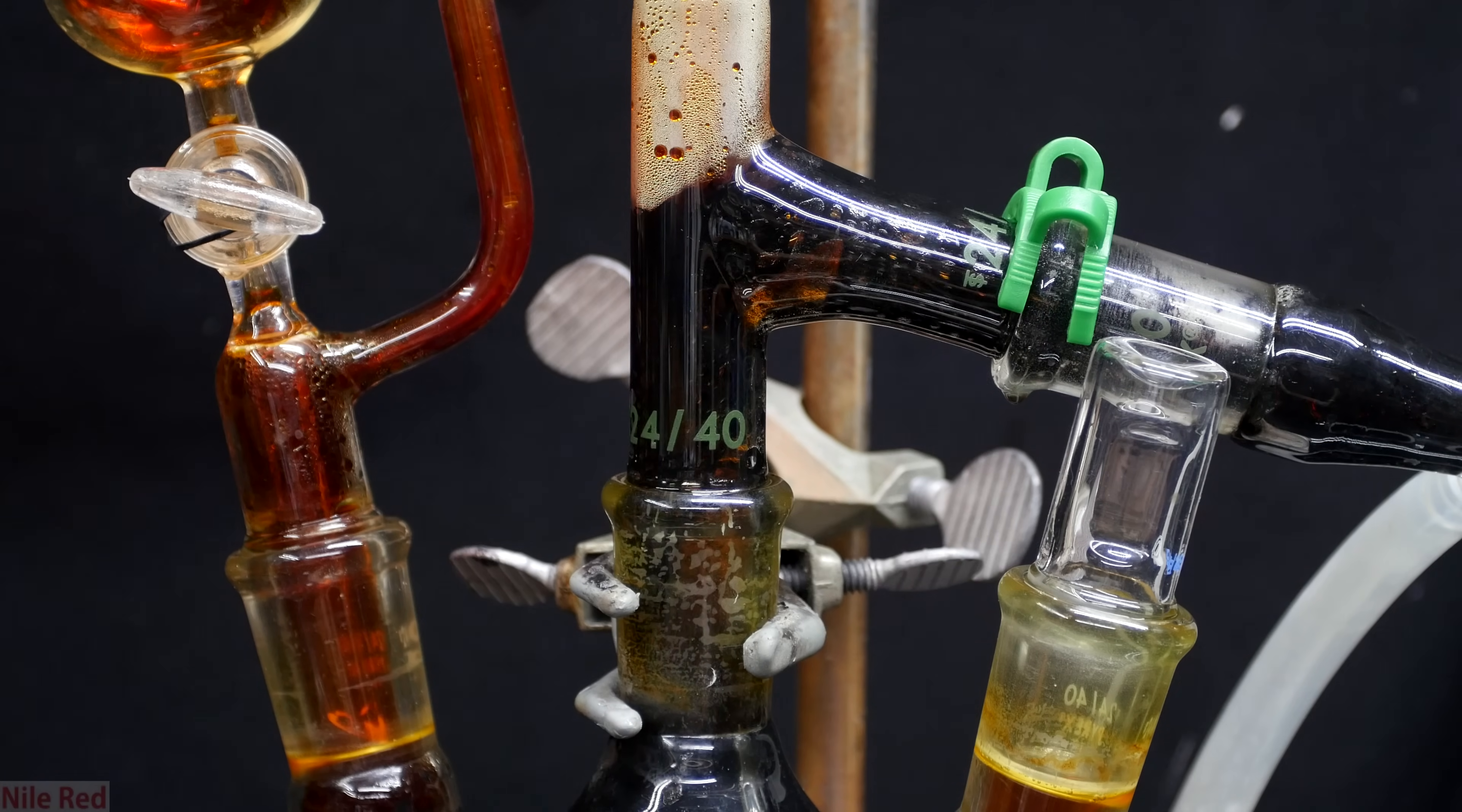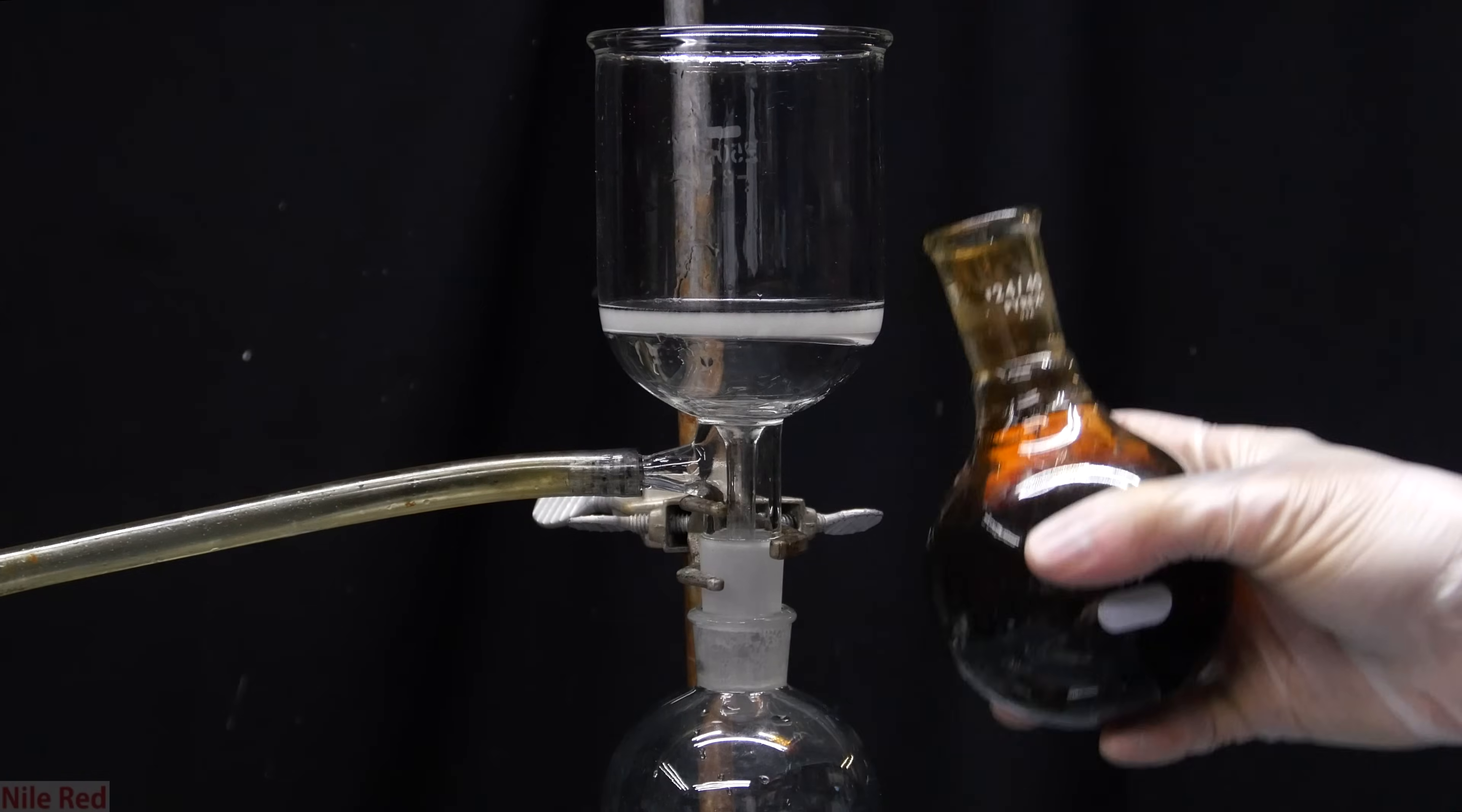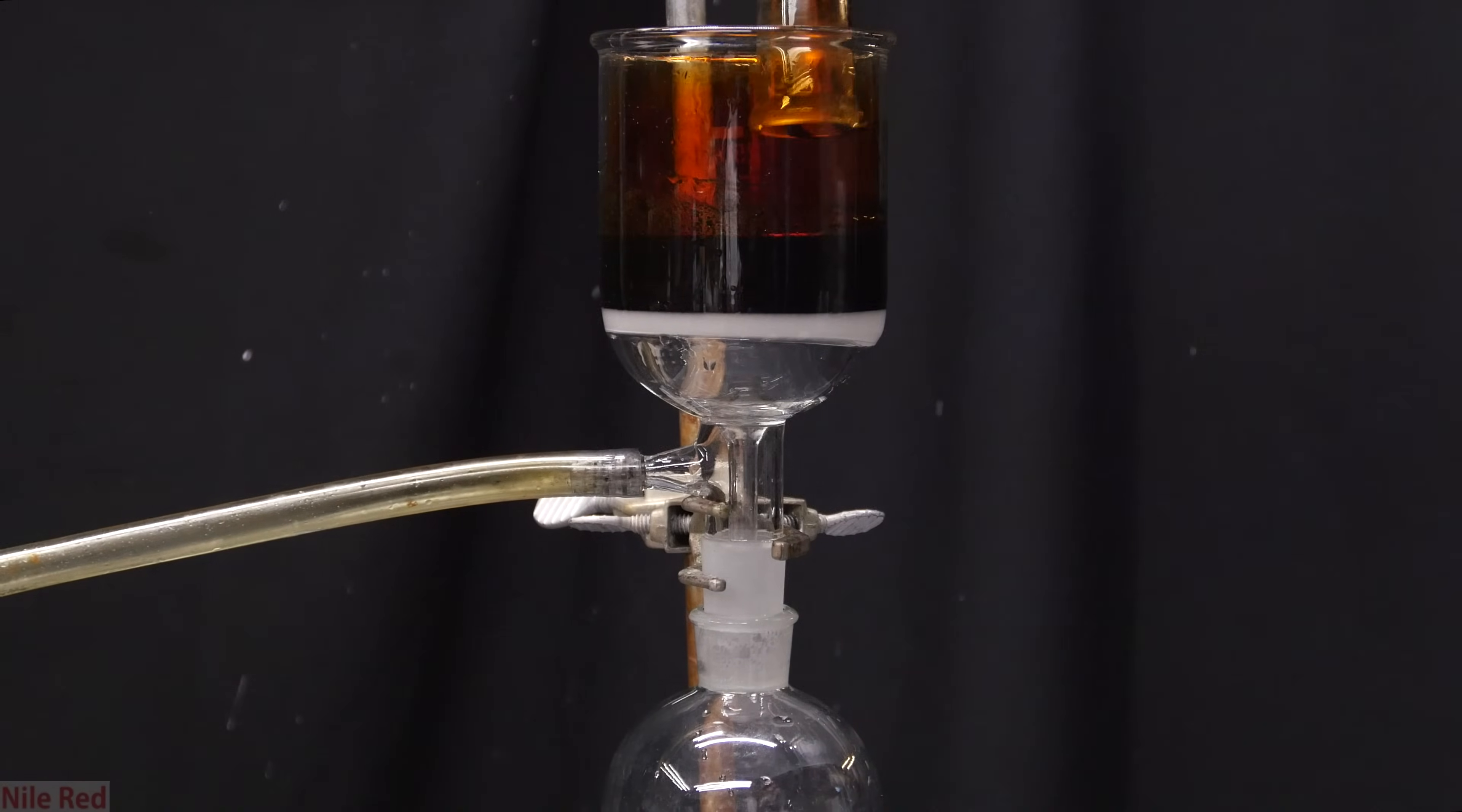I should mention that I did this synthesis just for fun, and it's not nearly as good as my previous one. My previous one has a much better yield, and it's a lot easier to clean up because we don't have to use manganese dioxide. In the future, I do plan to do an element series video for bromine, but that might take a little while because I have a lot on my plate right now. Anyway, with that being said, we can get started with the synthesis.